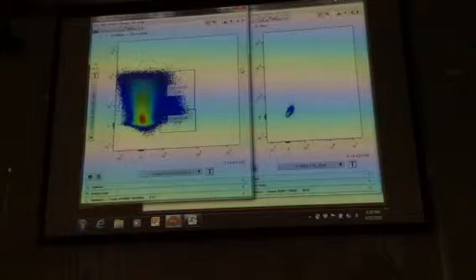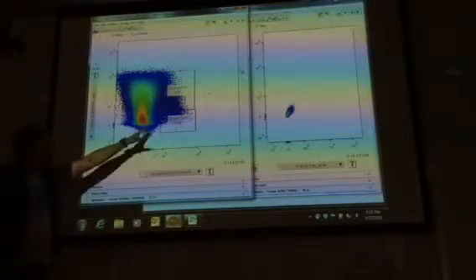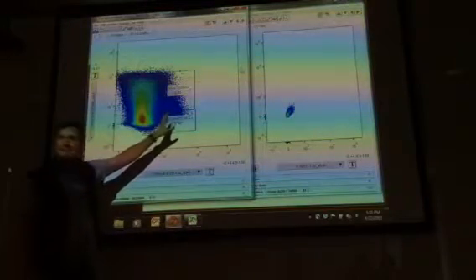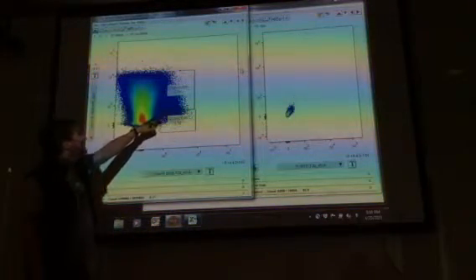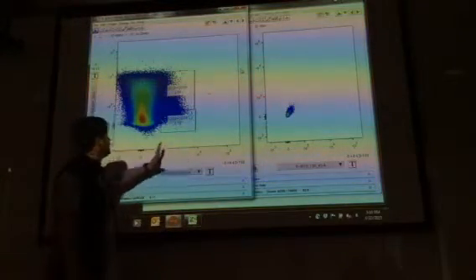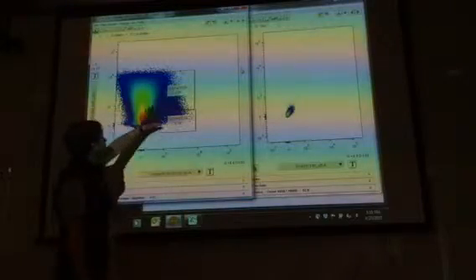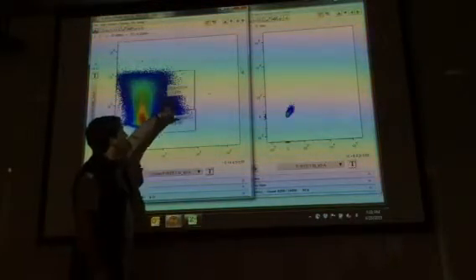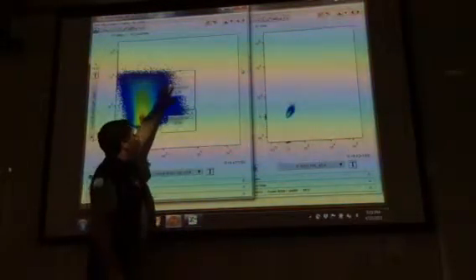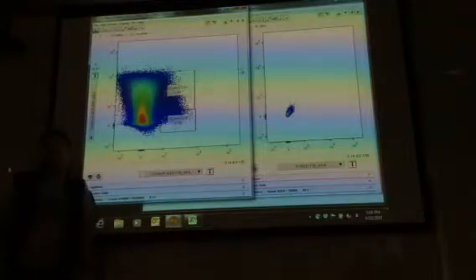So you have something like that. Who thinks that's right? Is the top one, they're both positive? Yeah, so this is 34 positive. So this is CD34. This is CD38. This is your 34 positive. They're all 34 positive, but this represents 38 positive, this represents 38 negatives.